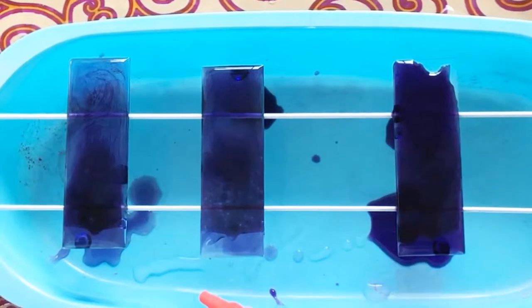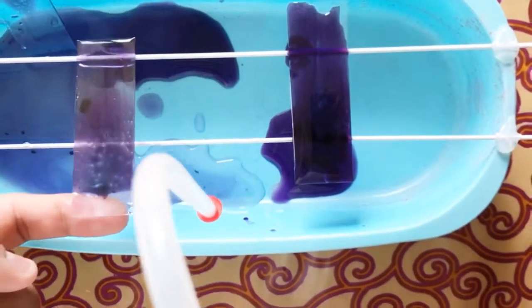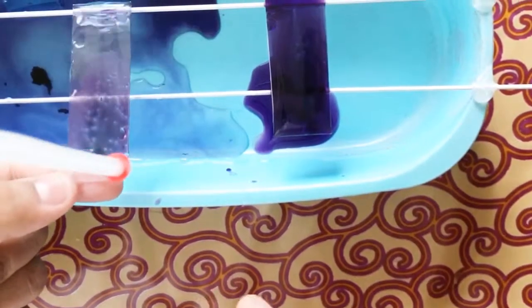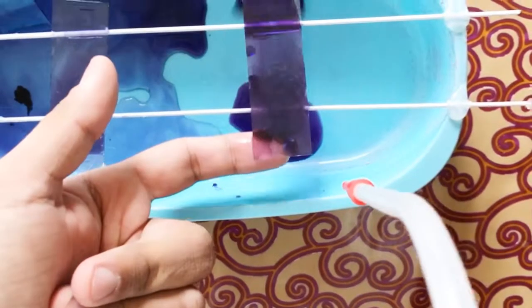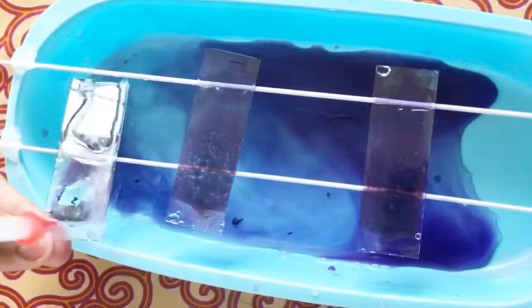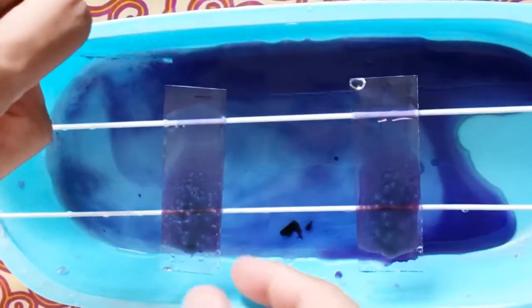After eight to ten minutes, tilt the slide and wash with tap water or distilled water — do not use full pressure, as this will wash away the blood smear itself. I demonstrate on one slide: tilting it and gently washing. On another slide I pushed the water too hard, and you can see the smear moved and washed away — so always wash gently and slowly.